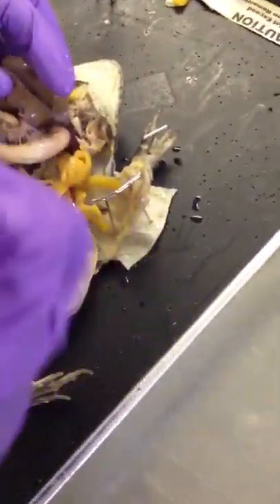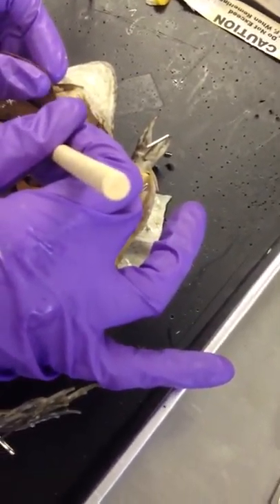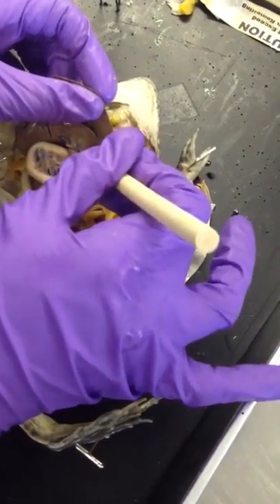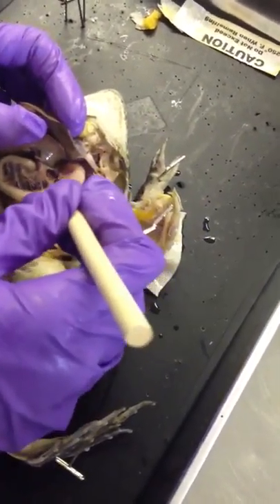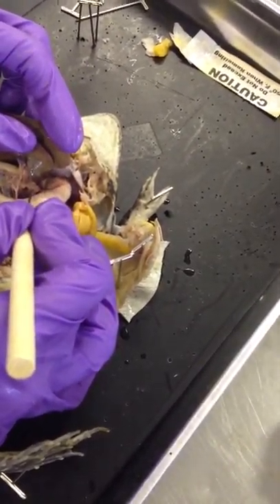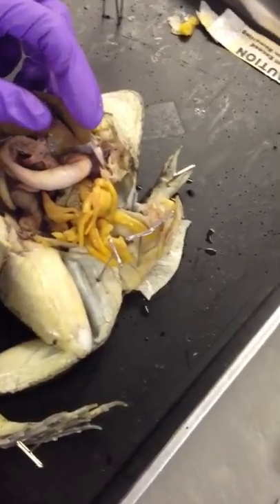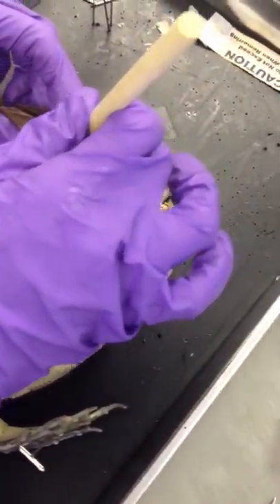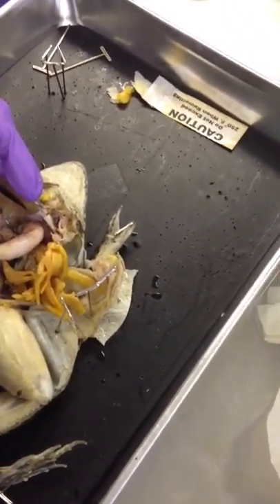Now we're going to look at accessory organs — pancreas and spleen. To locate the spleen, move the liver back. We have an outer curve and an inner curve of the stomach. Look for the inner curve of the stomach — right there is the pancreas. It's very small. I just disconnected some mesentery. All of this right here is pancreas.